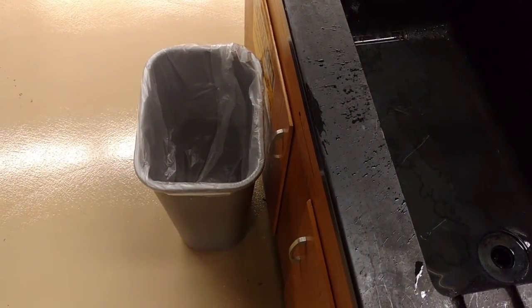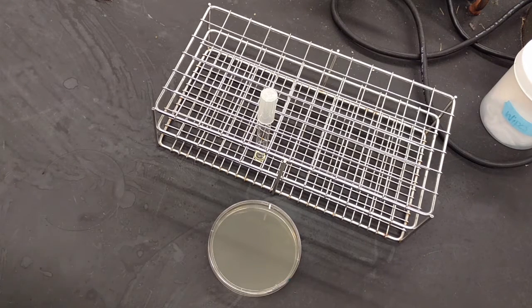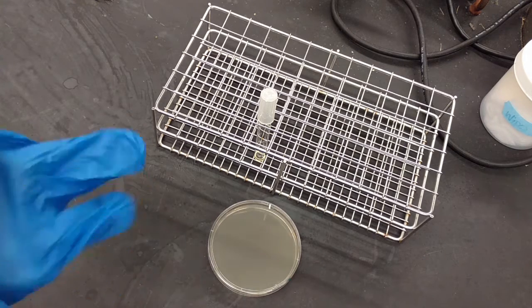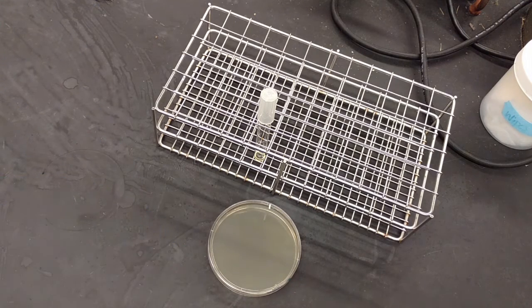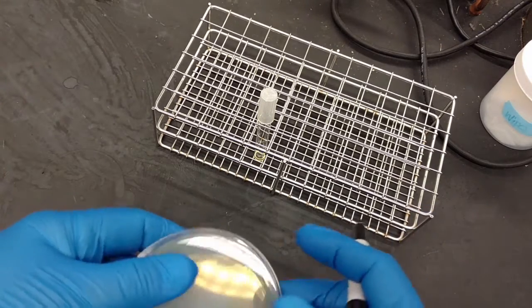The next thing you're going to do while you are waiting is make a plate. The enrichment is still spinning — it has to spin for 10 minutes — and while that's spinning we've cleaned our flask. Now we'll make a plate so that it's set and ready to go when we need it. Think about time management.